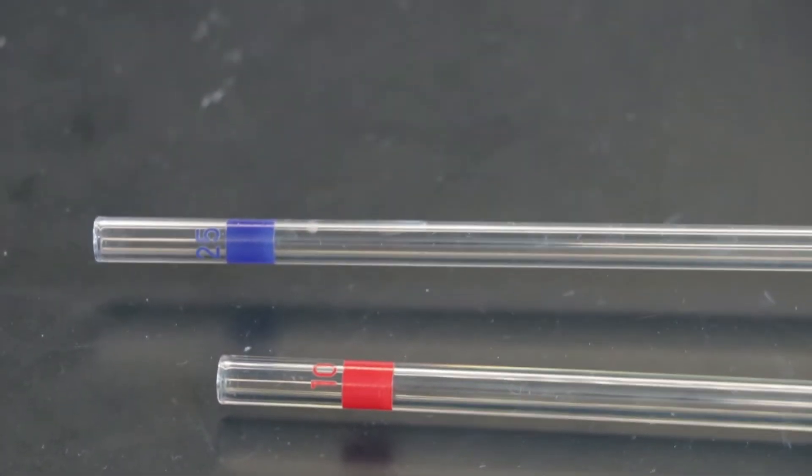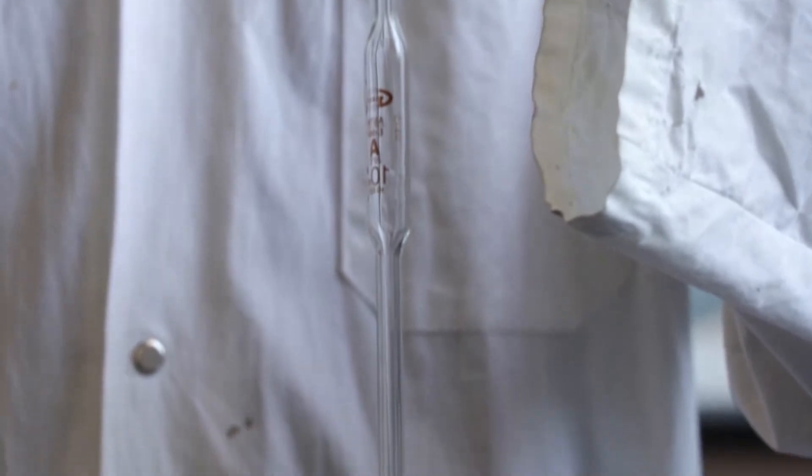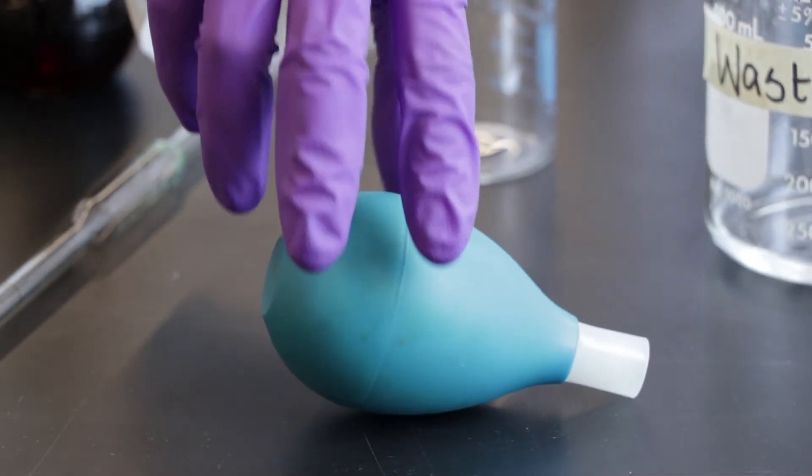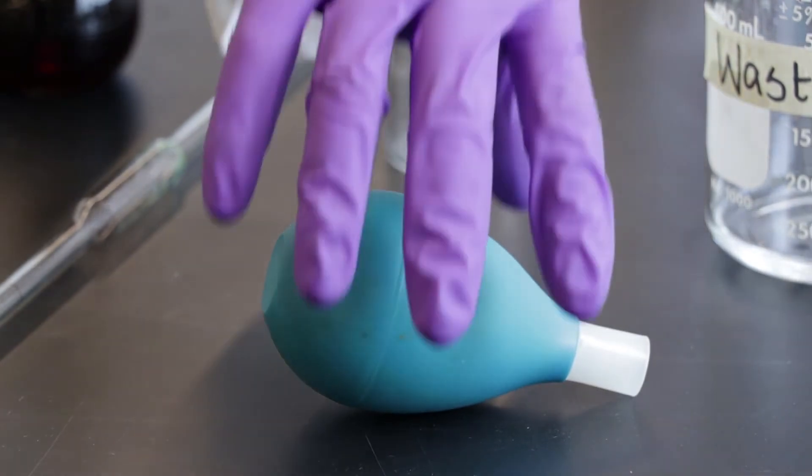The glass vessel which holds a liquid should be handled with your non-dominant hand above the wide part of the pipette. The demonstrator is right-handed, so he will use his left hand. The plastic or rubber bulb is used to draw the solution from the vessel and should be handled with your dominant hand.